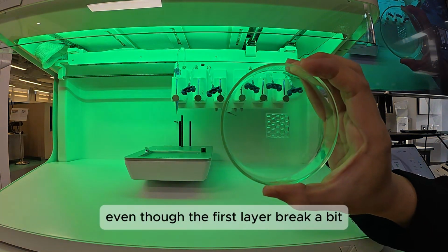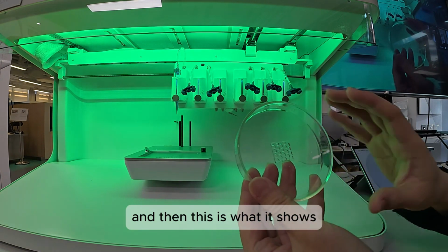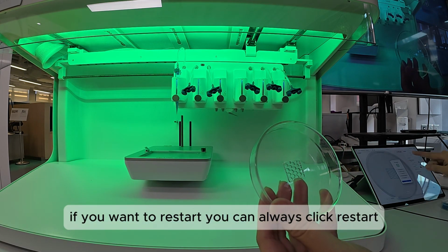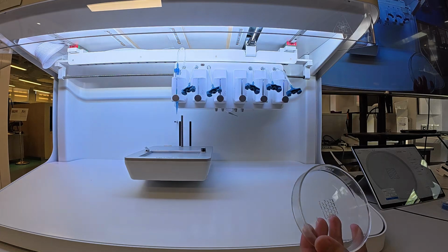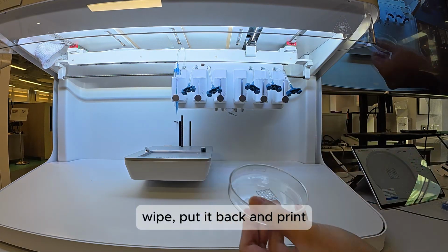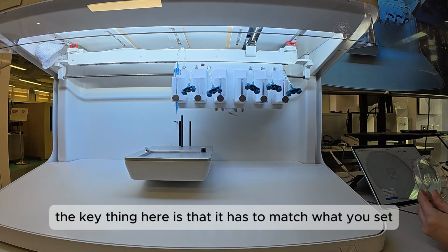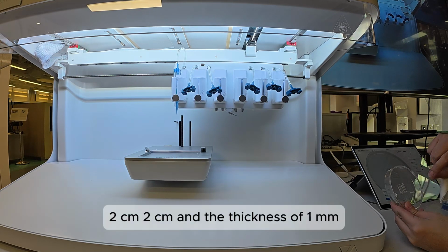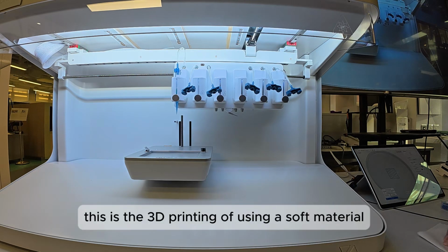So even though the first layer is a bit broken, the second layer is able to catch it, and this is what it shows. Of course, if you want to restart, you can always click restart, and then you can click start print again. So wipe, put it back, print. Then it will print the second one, the third one, and the fourth one. But the key thing here is that it has to match what you set, 2 cm, and the thickness of 1 mm. Yeah, so there is the 3D printing using a soft material.